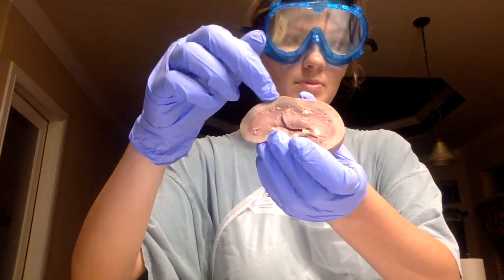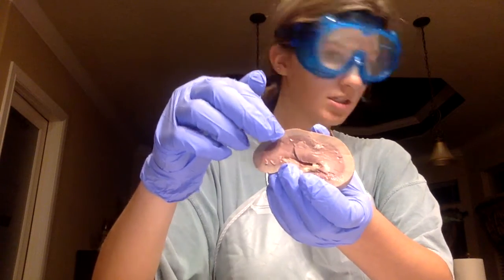And then the renal lobe consists of the renal pyramid and its portion of the medulla and the cortex. And it's hard to see in this structure, but it's kind of all of this part, the lighter and darker sections. And then the renal pyramids are part of the renal lobes.